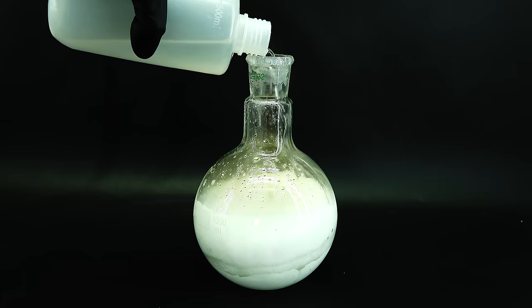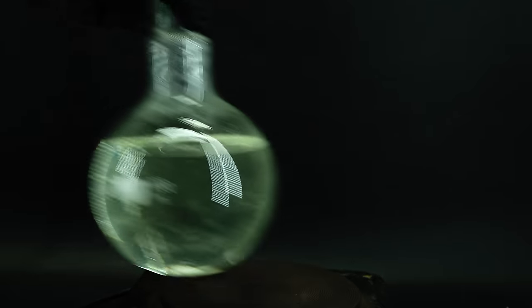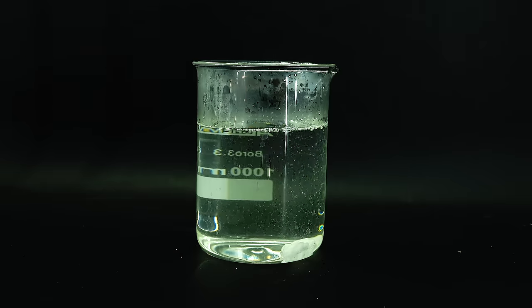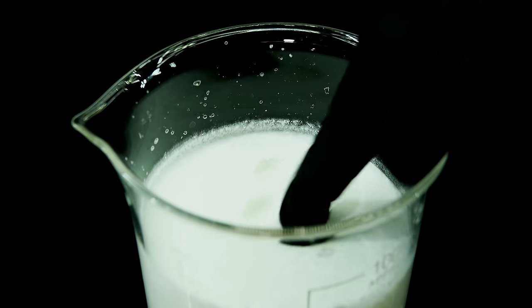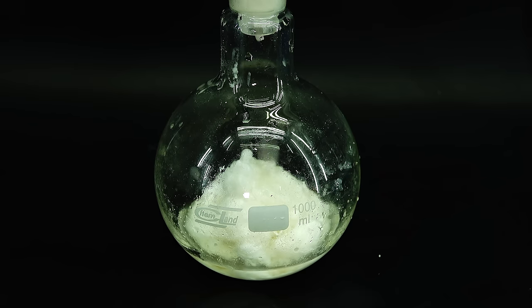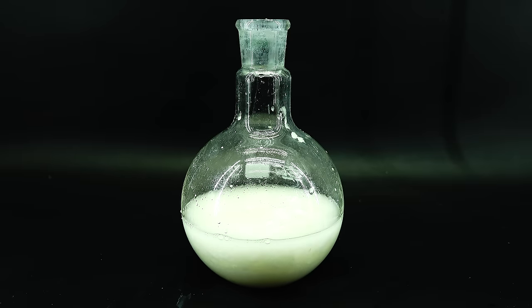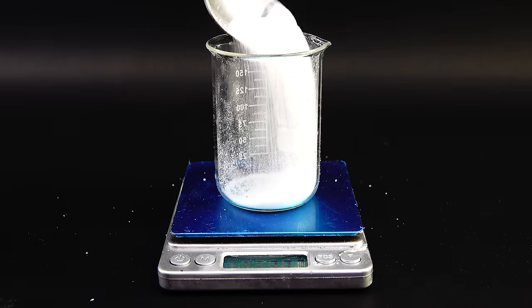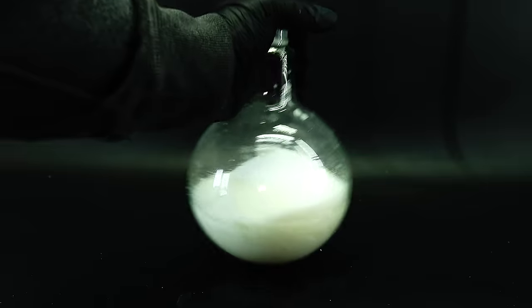To start, I first have to get the potassium bisulfate out of the flask. I filled it with a random amount of distilled water and got it onto this rusty electric stove, which did a really good job of warming it up, leaving me with a nice and clear solution. While it was still hot I quickly got it into a large beaker and then let it slowly cool back down to room temperature. This resulted in potassium bisulfate crystallizing out as these moldy-looking crystals, which were rather squishy for some reason. I transferred about half of them — roughly 340 grams of potassium bisulfate — back into the flask using a spoon and a funnel, which was really messy. With the potassium bisulfate ready, I weighed out 145 grams of table salt, mixed it with the contents of the flask, and the mixture was ready.